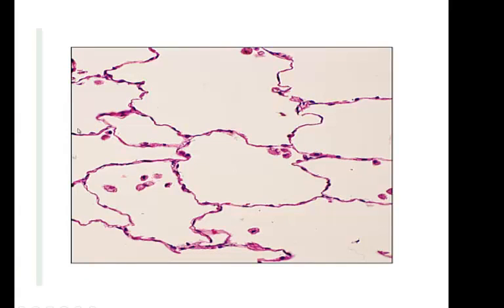Here's simple squamous again. So these are all simple squamous cells here, all these little flat cells going across, and you can see the nuclei to each of them. These are also cells that have been sloughed off, so you can see from above that they just look like little eggs. There's a nucleus inside of them. But this is what it looks like inside your lungs, and these are the air sacs inside your lungs. It's called an alveolus, lined with simple squamous cells.